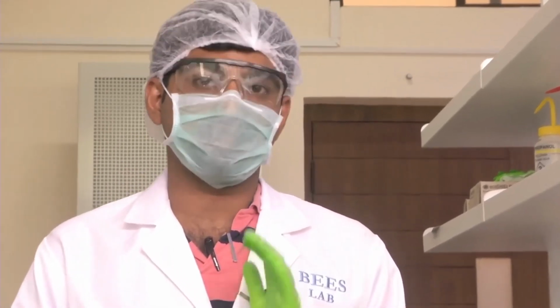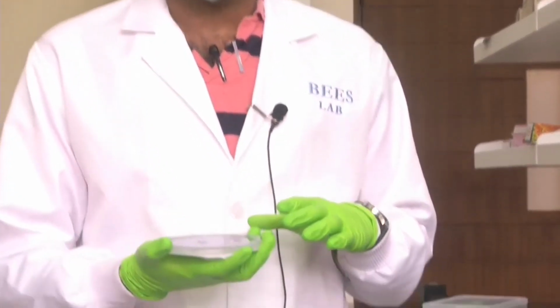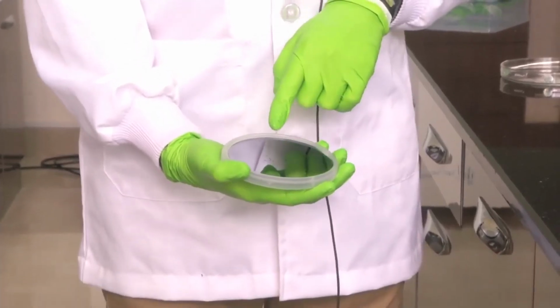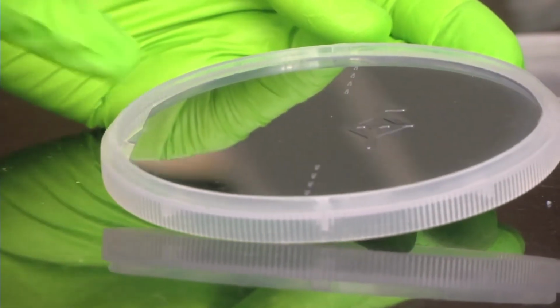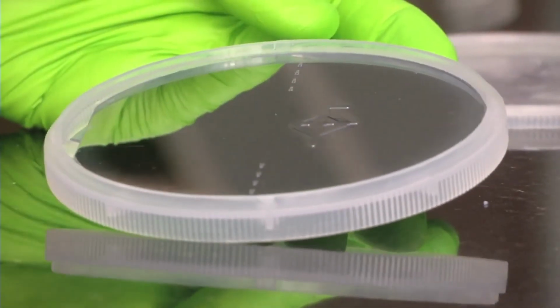Today we will actually be doing the PDMS molding using a silicon master. What is a master? A master is a mold which has the patterns on it, which will form the negative structures on the PDMS. So let us see what pattern we are trying to make. I have with me here a silicon mold. Can you see the pattern on its surface? This is the silicon master we will be using to make the microfluidic channels. As you can see, the channel dimensions are embossed on the silicon wafer.